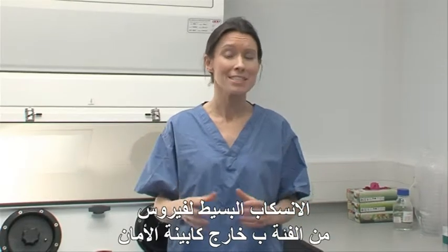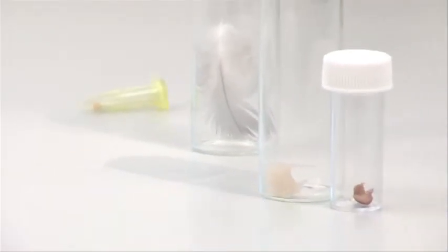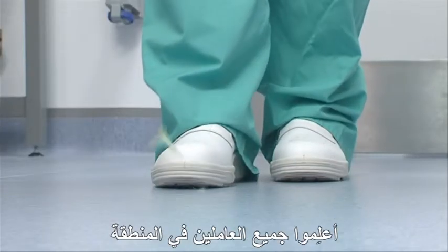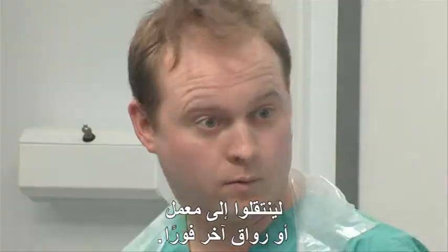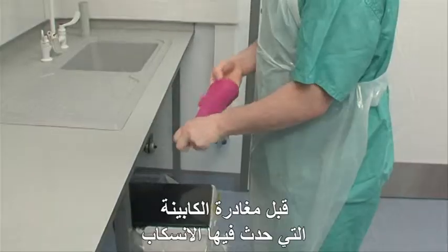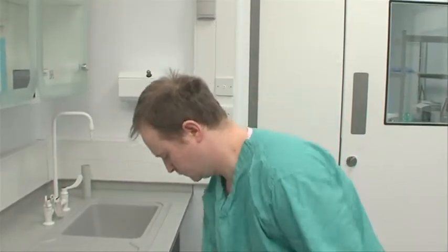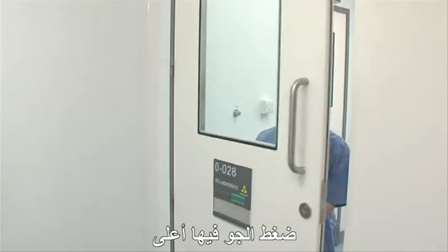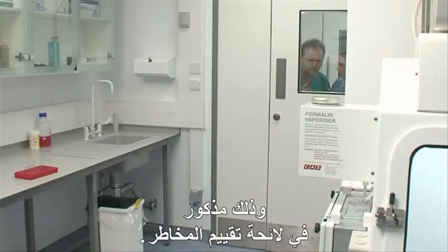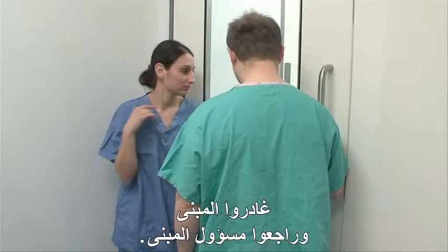A small spill outside a safety cabinet of a Category B virus might include a swab, a feather, or a small piece of tissue. Given the risk factors, the following procedures should apply. Alert all staff working within the area to move to another lab or lobby immediately. Prior to leaving the room where the spill has occurred, lab staff should remove any PPE. Relocate to a new area in the facility that's against the gradient of air pressure and assess what actions need to be taken. These will be listed in the risk assessment. If you are in any doubt, exit the facility and consult the building officer.